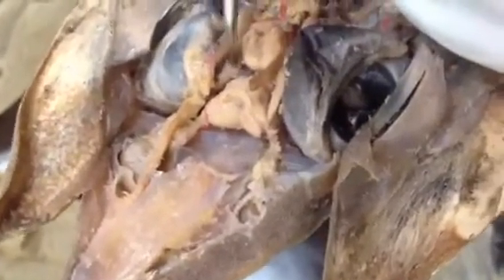Superior oblique? This one is the dorsal oblique. This one is the dorsal rectus. This one here is the anterior rectus. Then when you lift it you can see here — this one is the ventral rectus. No — ventral oblique. And under this one here is the ventral rectus.